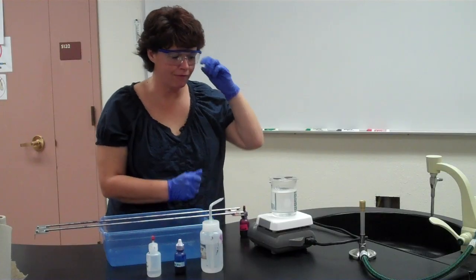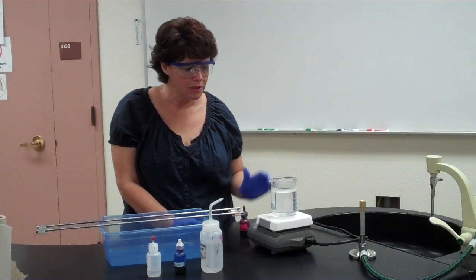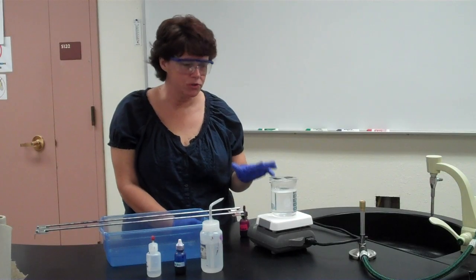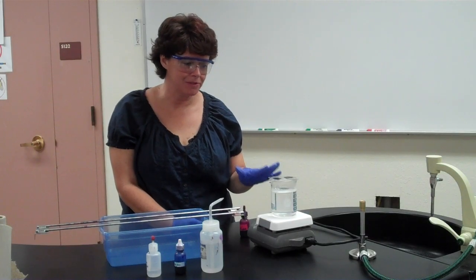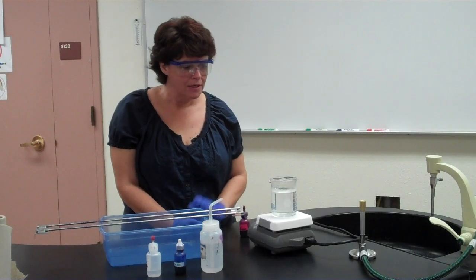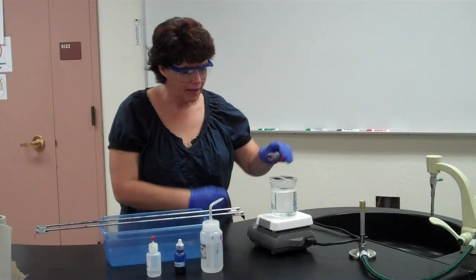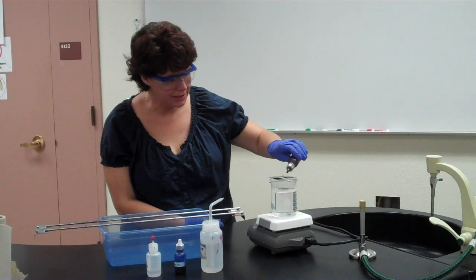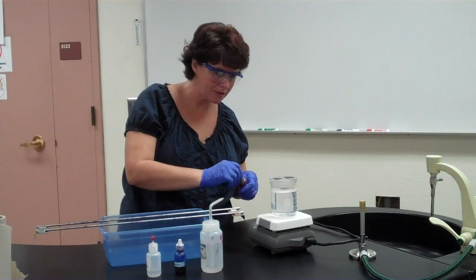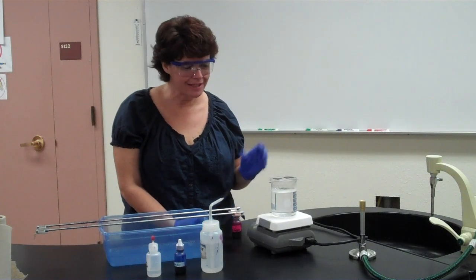I'm not going to sit here for 5 minutes steaming, but one of the things I want to point out is as you're doing this, you want to make sure that the carbol fuchsin doesn't dry out, and steam is going to make it dry out pretty quickly. So while it's steaming for the 5 minutes, if you notice it starts to dry out, add some more. Okay? But once again, we don't want too much in the water. If you get a little bit, that's okay. But if you have a big red beaker when you're done, it's too much.